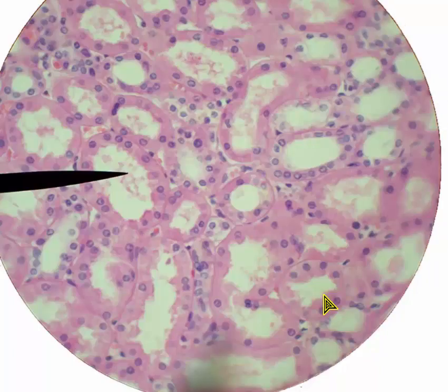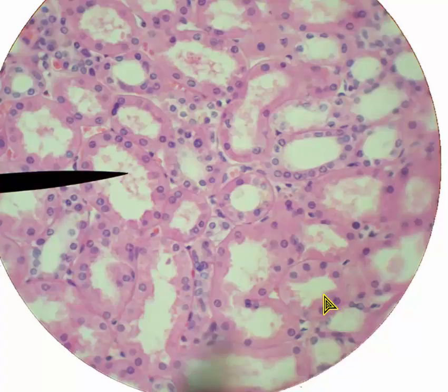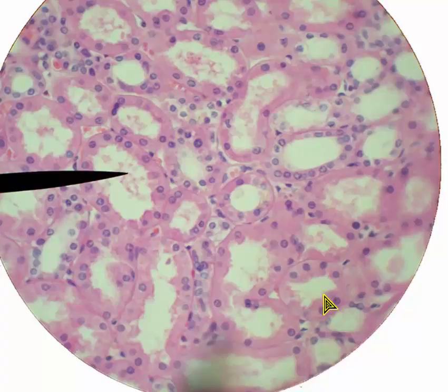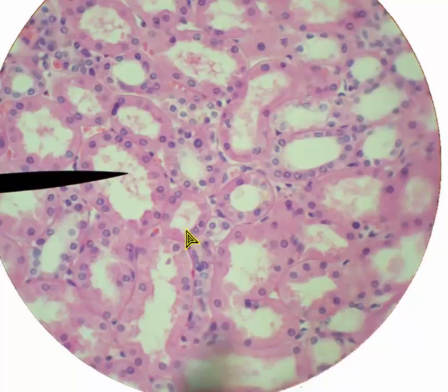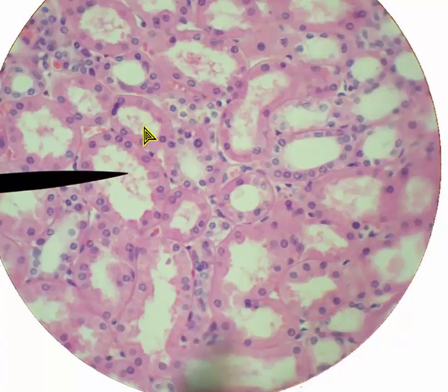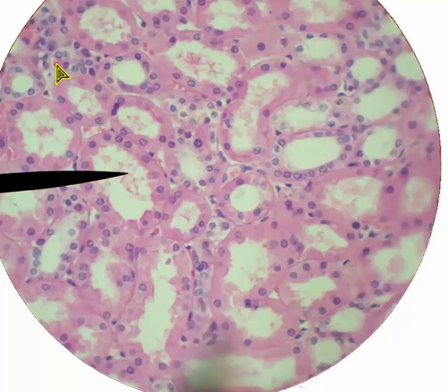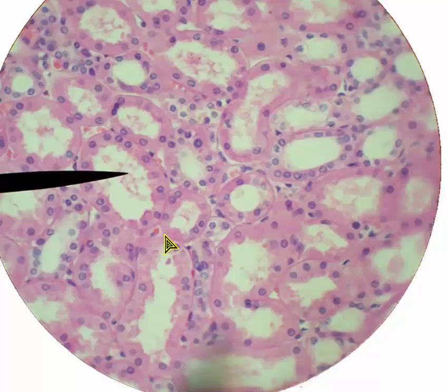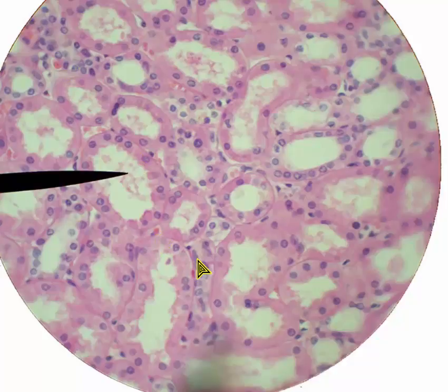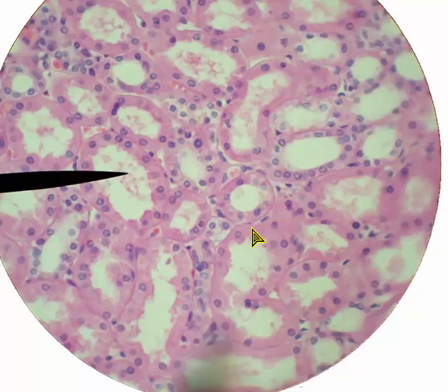This is also in the cortex of the kidney, just an area in between the renal corpuscles. So what we see here are renal tubules and peritubular capillaries — including kind of a squished peritubular capillary. And that's what we see in this view.